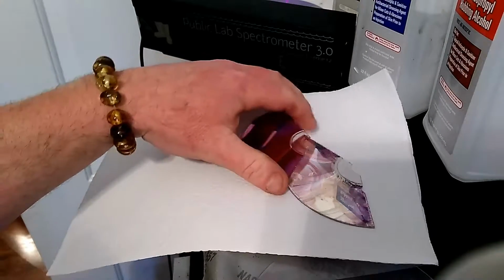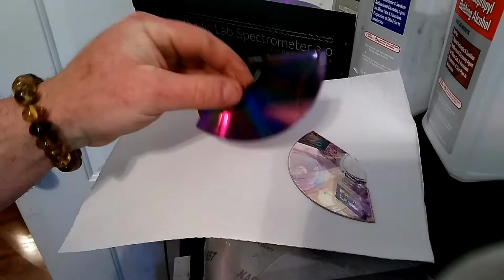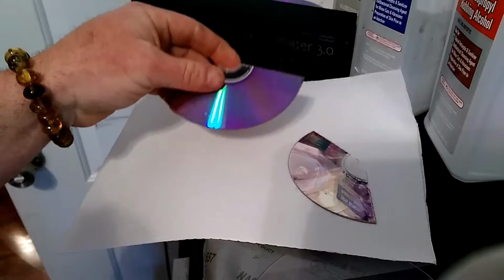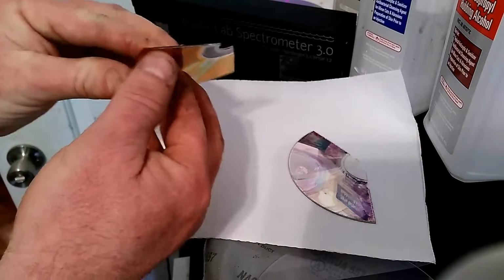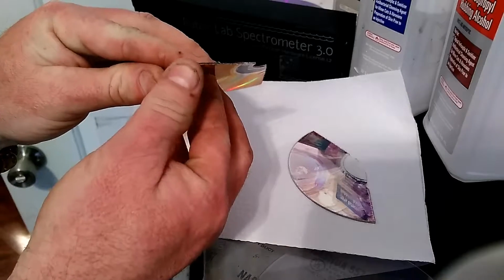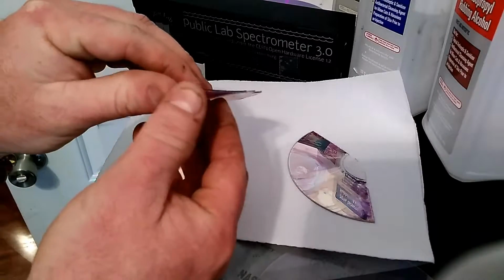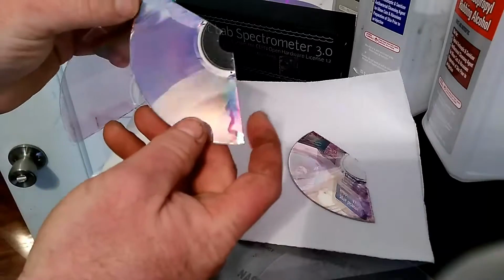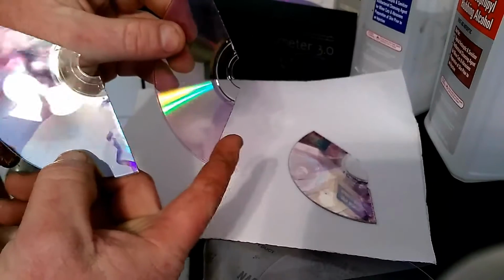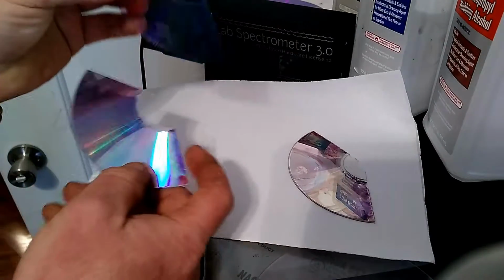The thing they did though is give you the DVD cut in pieces, but it's not separated. So what you have to do, once you cut it, is separate the layers. These are Maxell DVD-Rs. They're actually really easy to separate, and I think cutting it with really hard, bad scissors makes it open a little better.